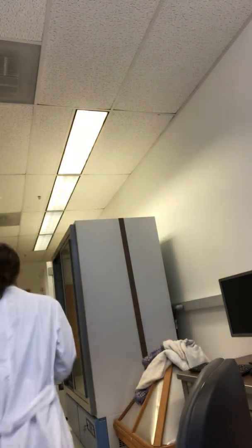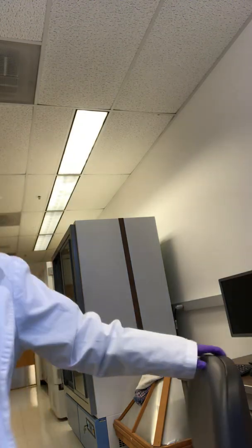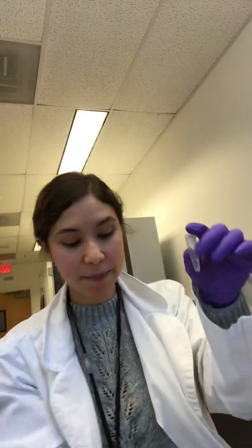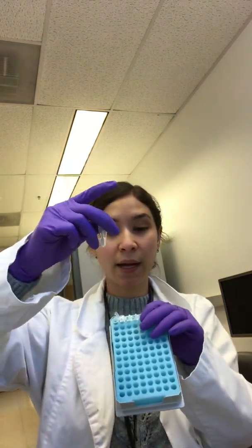After your master mix is in, you are going to grab your samples. Let's say this is sample number 1. It's going to go into tube number 1. You're going to open up tube number 1 with your nail on the corner. Make sure you don't touch the top again. You'll go inside your sample number 1, pipette up and down 3 microliters, and put 3 microliters into your strip tube. Put sample number 1 away, close the top carefully. Go to the second one and repeat that process all the way down to your negatives. Your negatives, you're going to add 3 microliters of H2O.